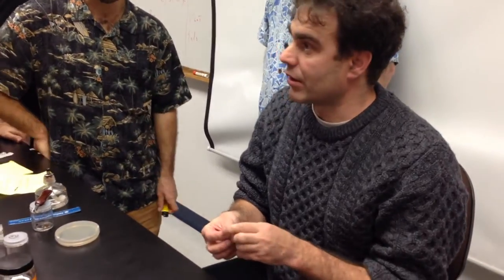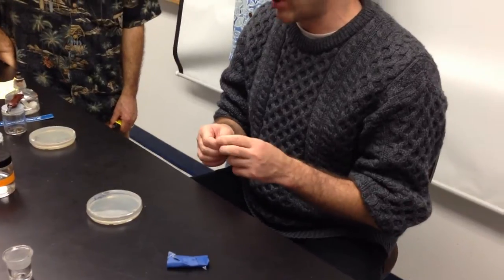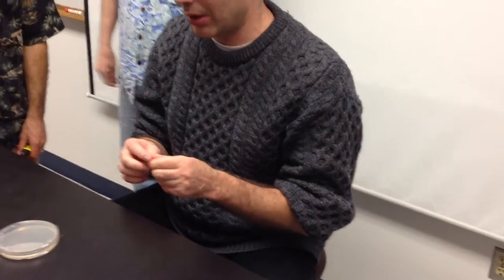This is PDA also, for the poop? This is ME. But PDA will work also, because Basidiobolus is actually not about, really, some fancy stuff.